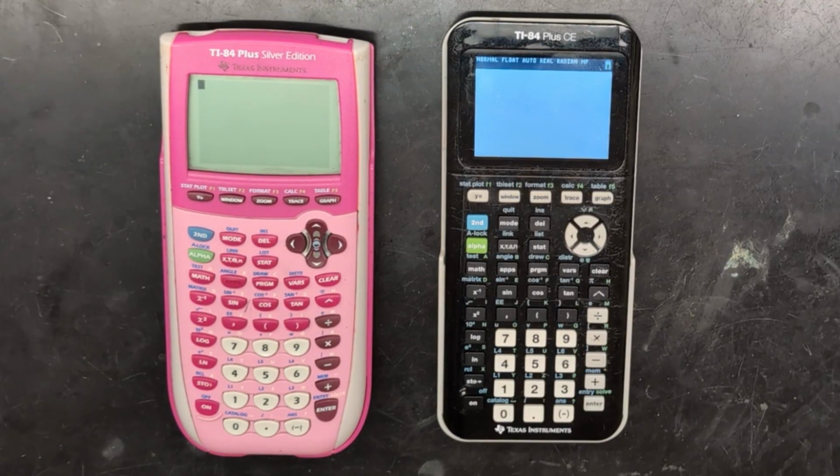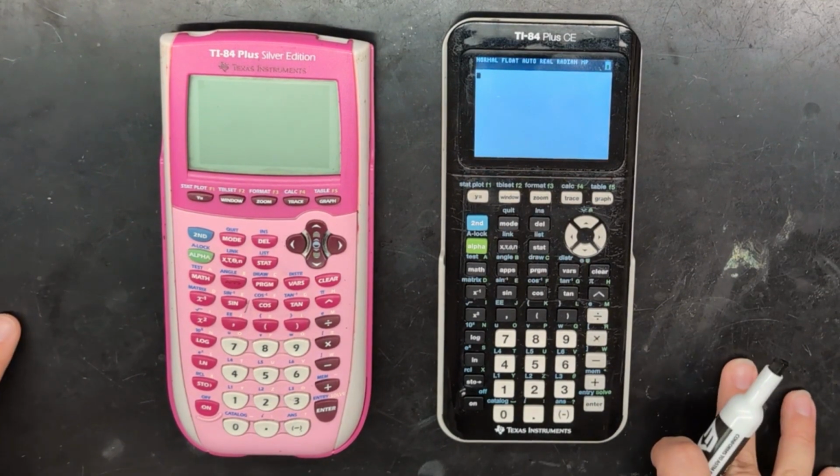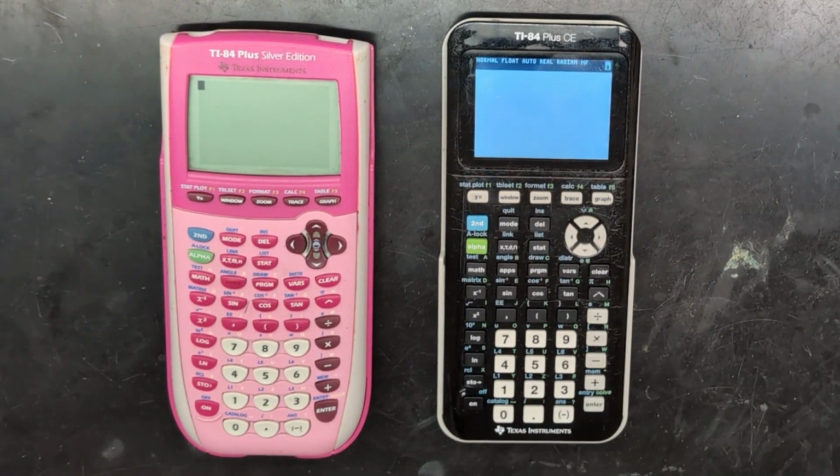Okay, next thing you want to do is make our calibration curve, find the line of best fit. You can absolutely do this using the LabQuest or your ProbeWare itself. It has that capability. You could also use computer software, Excel, Google Sheets, something like that. I know that my students will have access to graphing calculators in class, whereas we don't always have access to the computers. So I like to make sure I do one lab where we graph it using the graphing calculator, and one of the other labs we graph it using the LabQuests themselves.